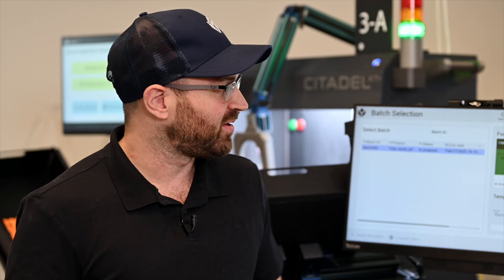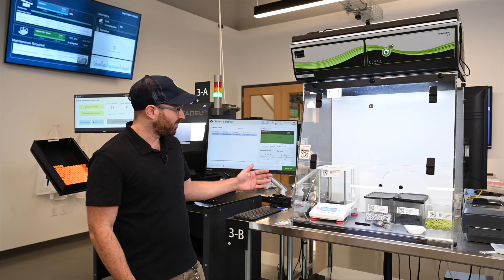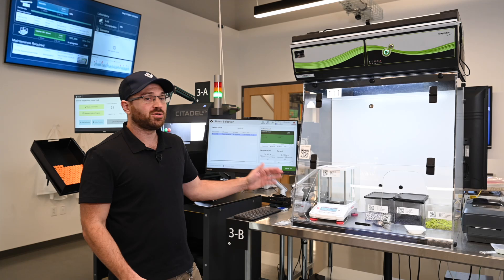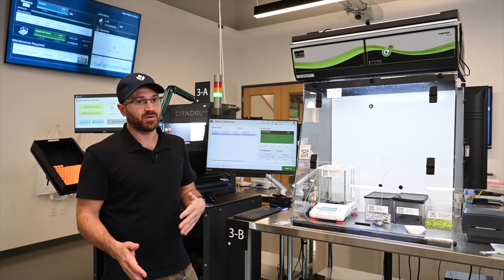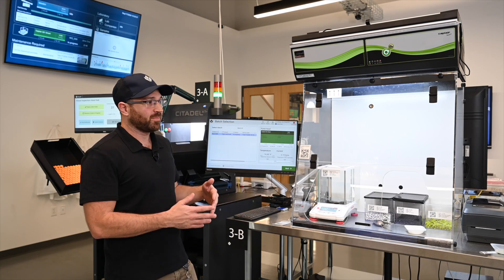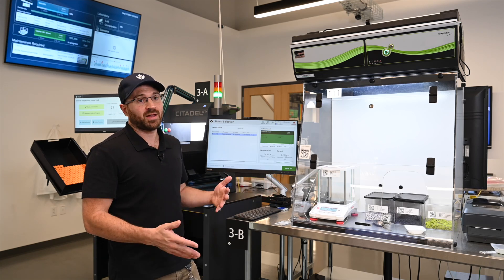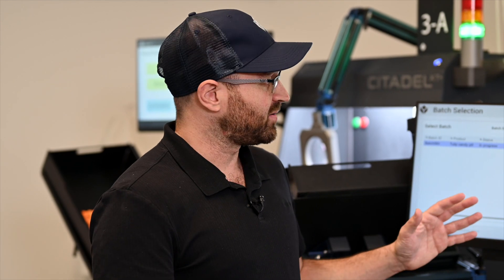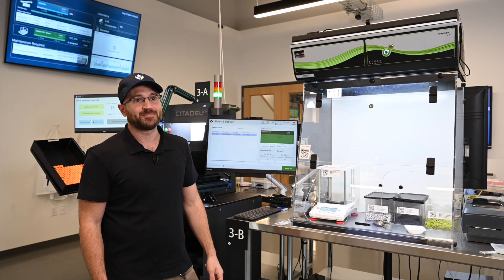So in this demo, what we've shown you is the ability to connect to devices. Many devices connect with Tulip, and they can be used to guide operators through workflows and actually make the process more compliant. This whole thing is configurable, and this is an example of a simplified version of a weigh and dispense process. It's available in our library. Thank you.